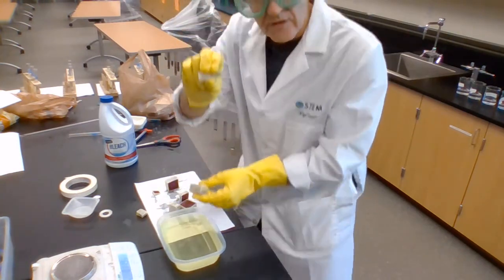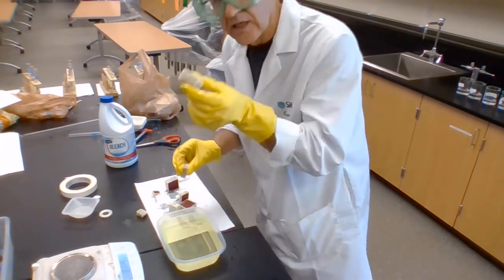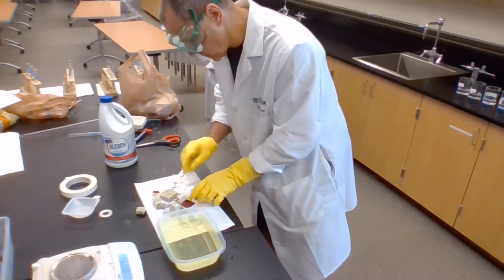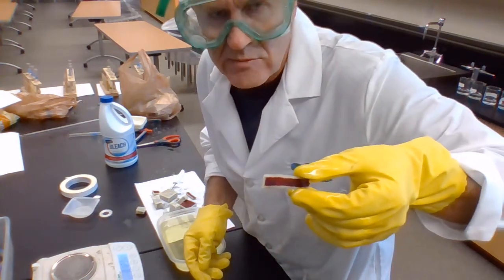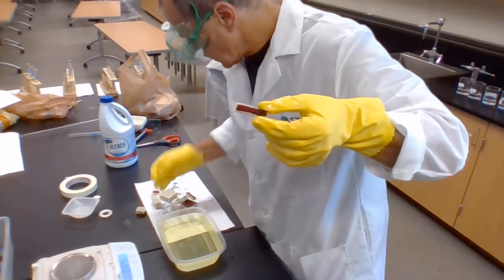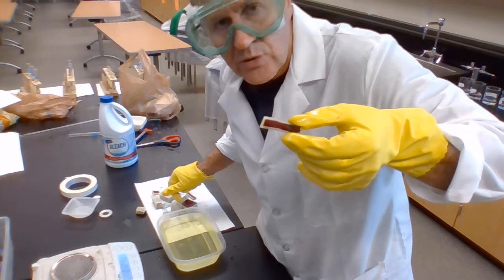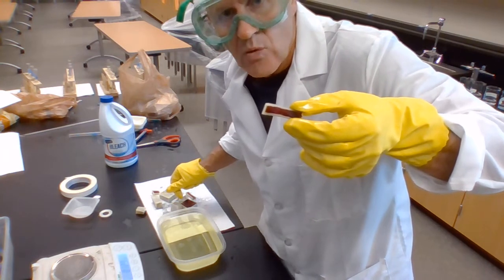So let's have a look at these ones. So we had this idea of a 1 centimeter times 1 centimeter times 4 centimeters, and this one 2 centimeters times 2 centimeters times 4 centimeters. And I'll cut them lengthwise. So you're sure what's going to happen. They've gone about 2 millimeters. And yeah, you can see that this one, maximum diffusion distance of half a centimeter, 5 millimeters, it's going to take about the same amount of time as the 1 centimeter cube to get its oxygen throughout. So it gets more volume, so it can have more organelles in there, but its diffusion distance is the same as the 1 centimeter cube.